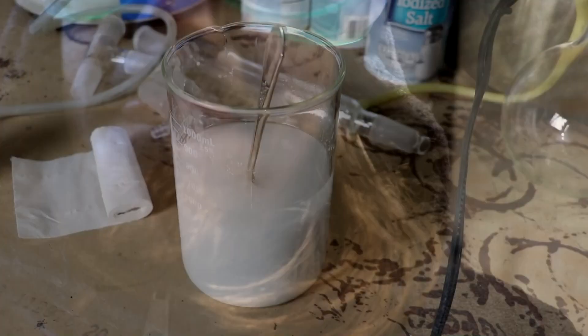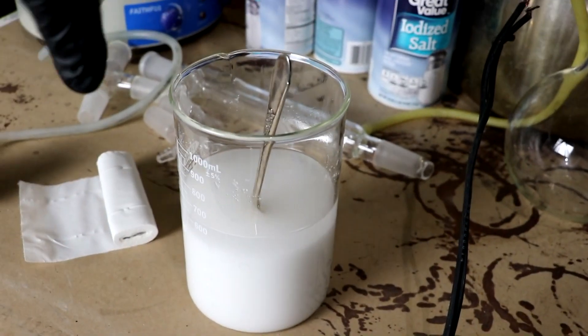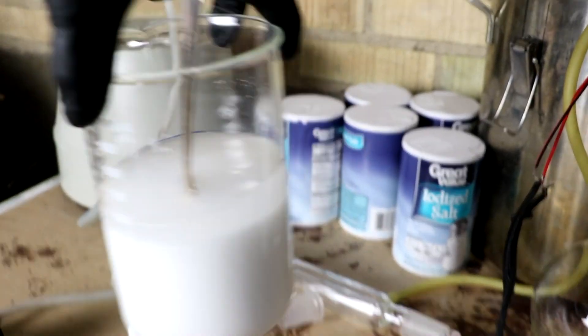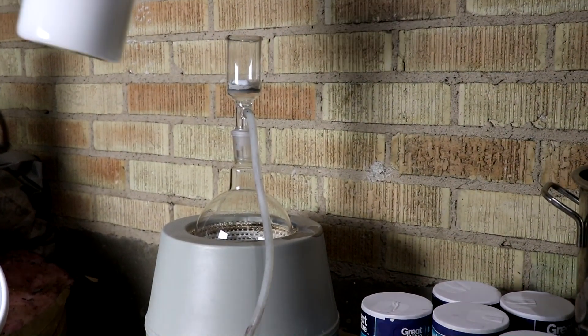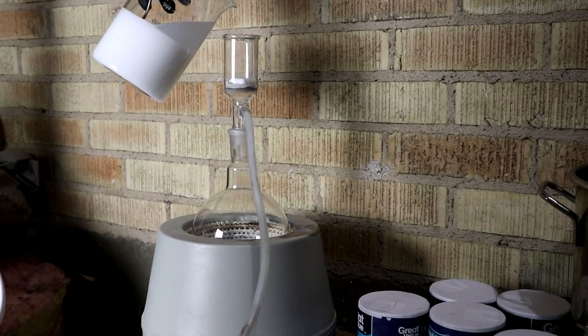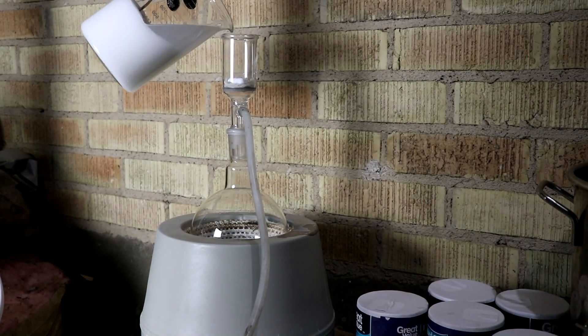Might have to add more. One thing I'd like to mention real quick is that I'm working at very low temperatures. If you're working during the summer and the acetone had a higher vapor pressure, you'd want to do this in a fume hood. Which I will be getting soon, by the way.